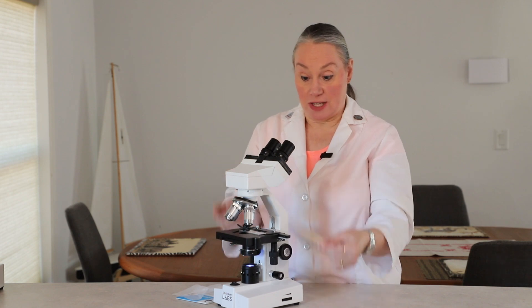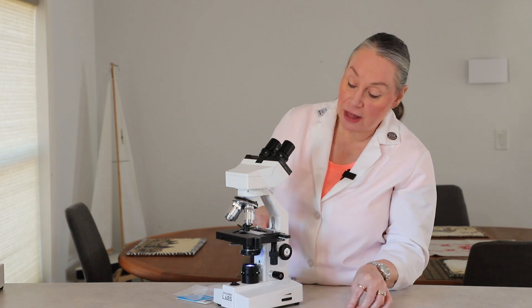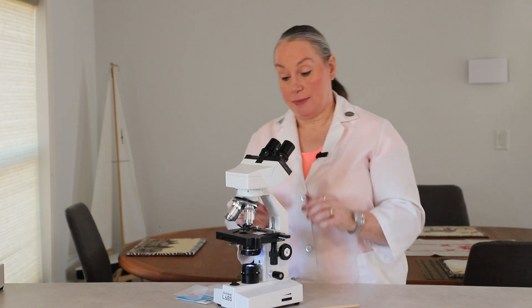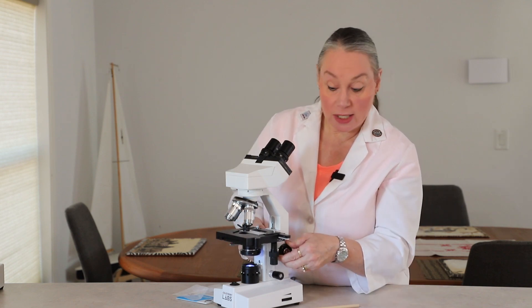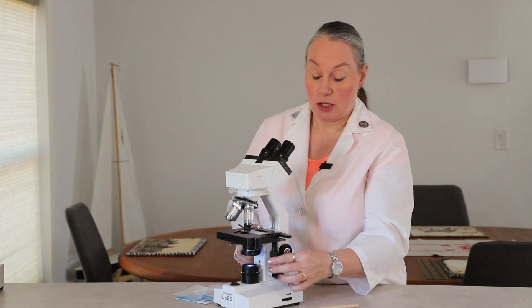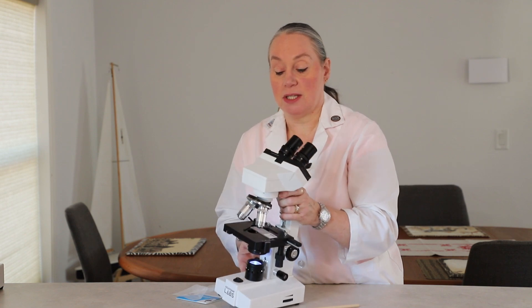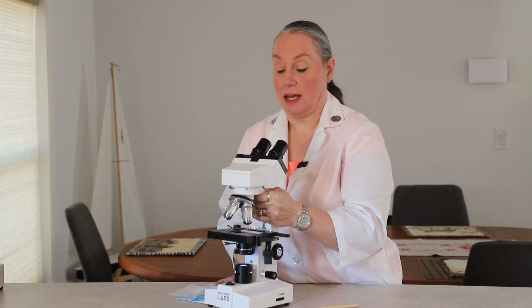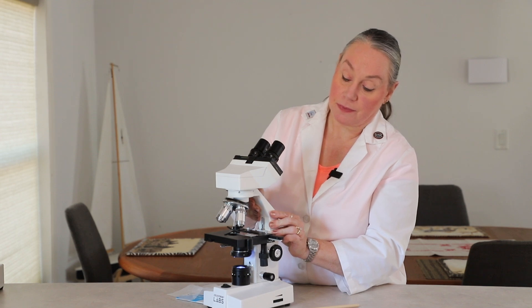So you've got all the basics: you've seen the parts, you've seen the parts move, you know how to calculate magnification. When you set this up and get it started, you want to make sure that your stage is all the way down away from the objectives. You want to put your microscope slide in place and use the stage adjustments to move that specimen in the light so that it can be seen being magnified. And you are on the red ring, which is the low power objective. Now we're going to be on to how to set up those slides. I hope you enjoyed your orientation to your new microscope.